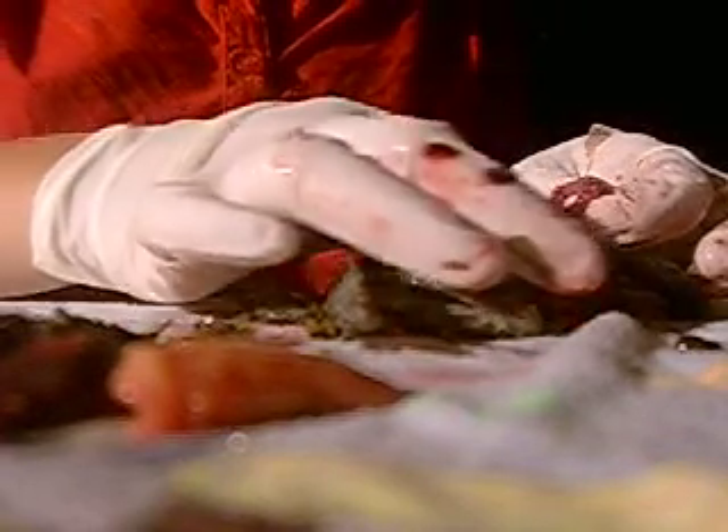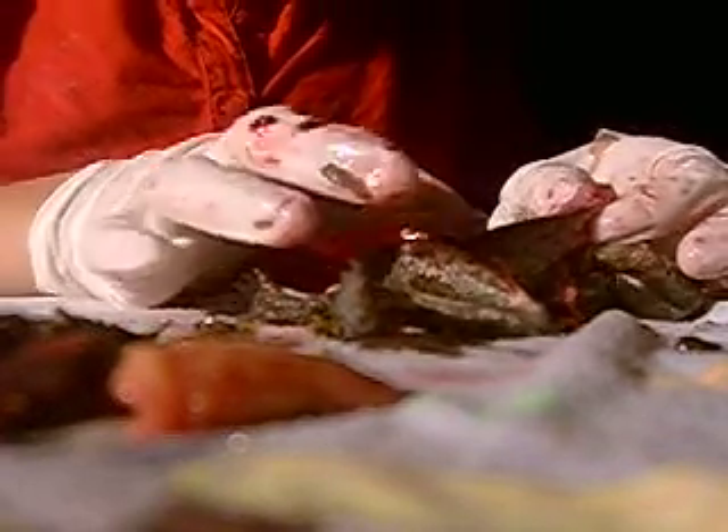It's actually near its back — under here, near its throat, up here, down near the throat, under the throat, near its back sort of thing, about its heart. This is the heart right here. Open it, see it — I'll cut it with a knife so we can see it. Pretty tiny, it's smaller than a five cent piece, about half the size of a five cent piece.